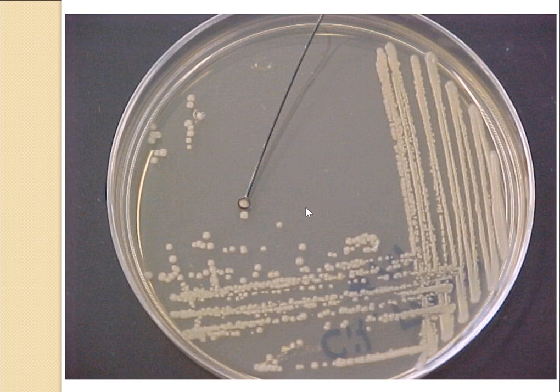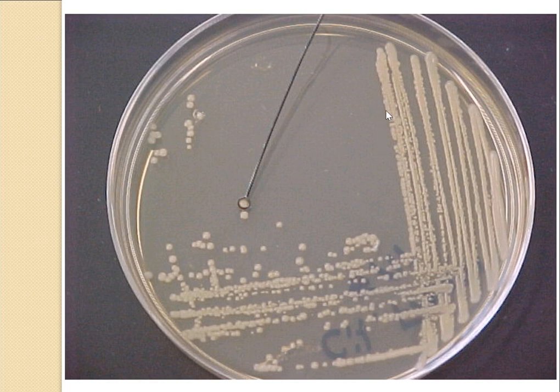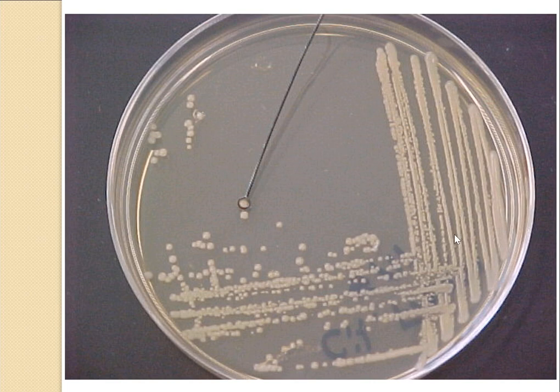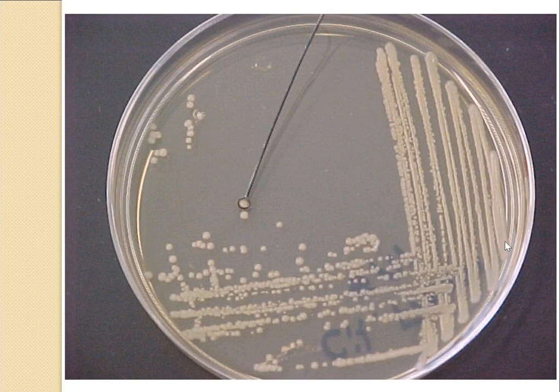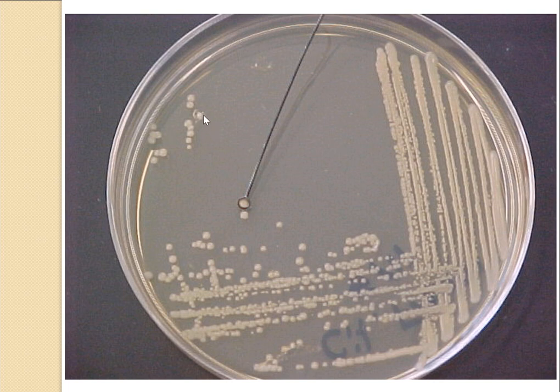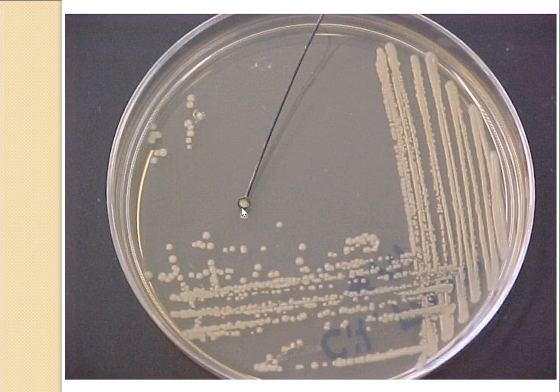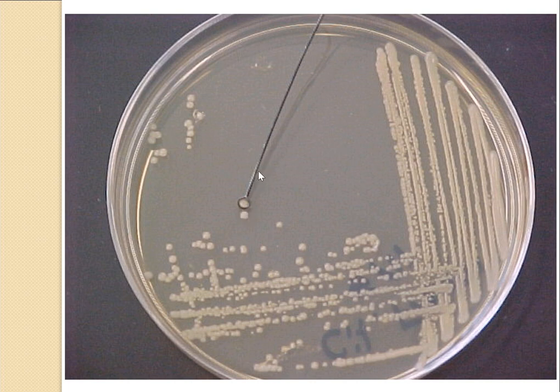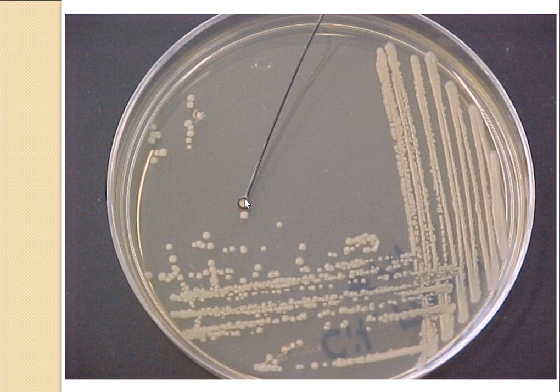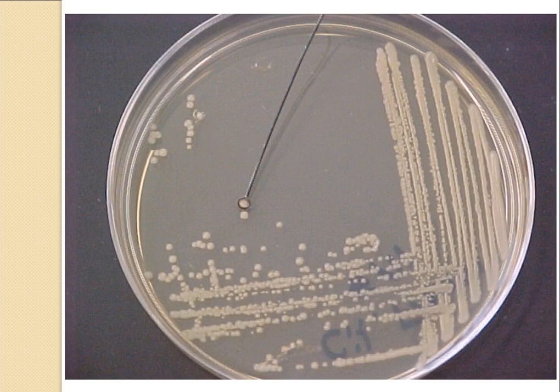As another example using Staphylococcus aureus: the first quadrant has a large number of colonies, the second quadrant has fewer, the third quadrant has even fewer, and in the last quadrant a single colony can be identified. This colony can be scraped with the nichrome wire loop and transferred into another nutrient media to grow a pure culture of Staphylococcus aureus.